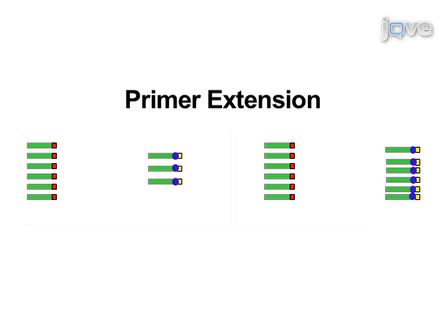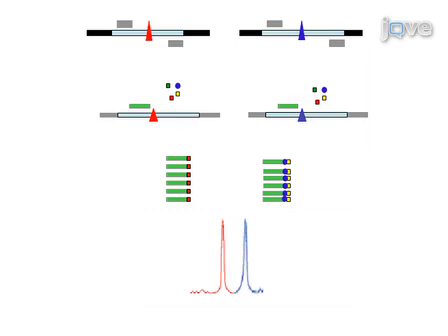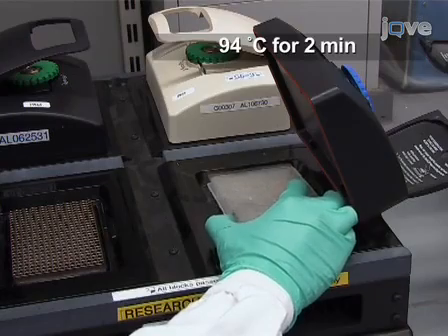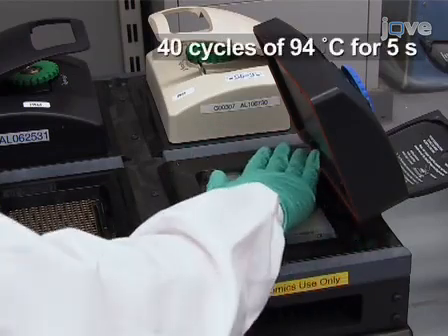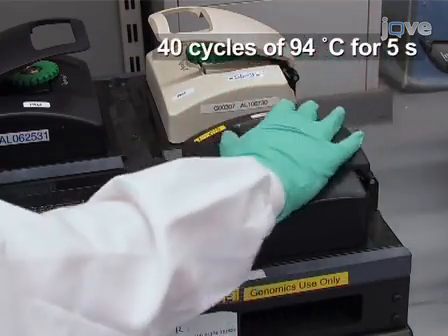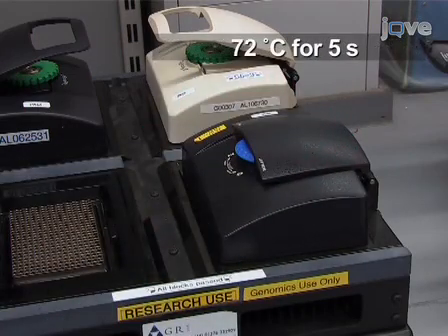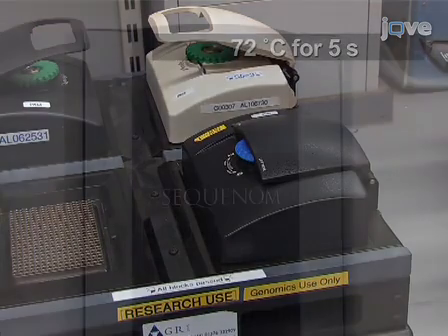Specify primer length in the range of 14 to 18 base pairs. Carry out the primer extension reaction with the appropriate mix of 3 dideoxynucleotide terminators and 1 deoxynucleotide. A typical primer extension reaction includes a starting step at 94 degrees Celsius for 2 minutes, followed by 40 cycles of 94 degrees Celsius for 5 seconds, 52 degrees Celsius for 5 seconds, and 72 degrees Celsius for 5 seconds.